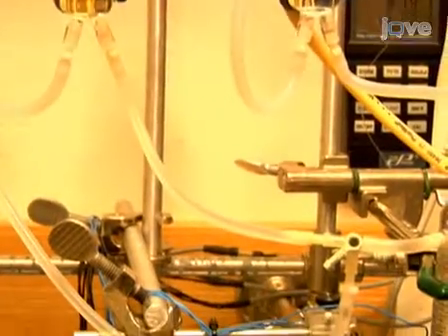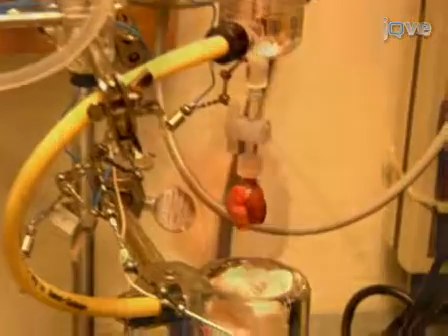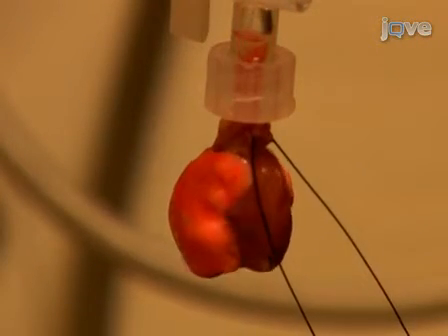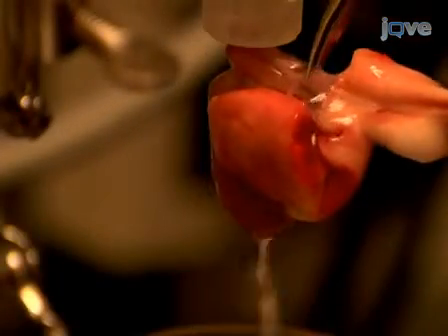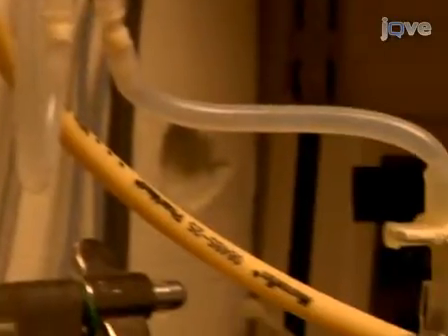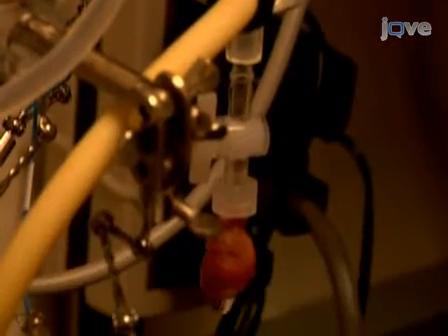Retrograde coronary vascular perfusion is now established with the warm, oxygenated Krebs-Henseleit solution from the pressure head of the Langendorff apparatus. Now remove extra tissue, including the lungs. After cleaning, perfuse the heart for 20 minutes to permit recovery of function and stabilize the rhythm.